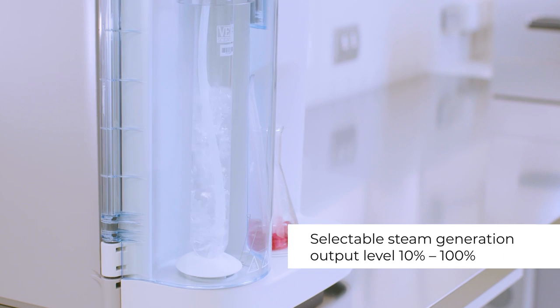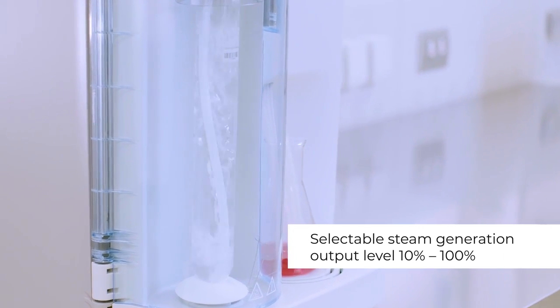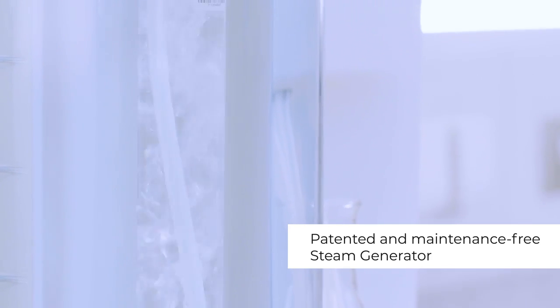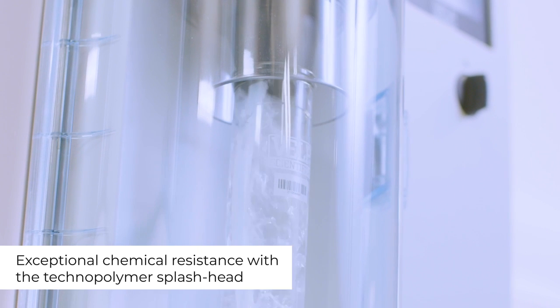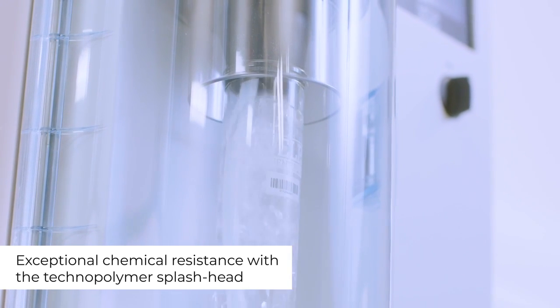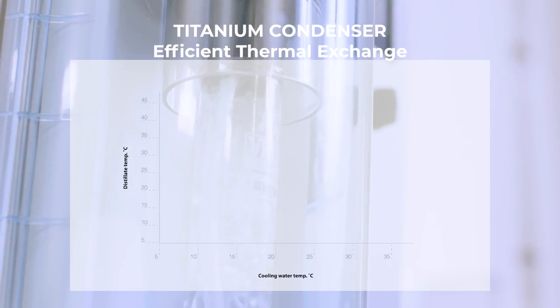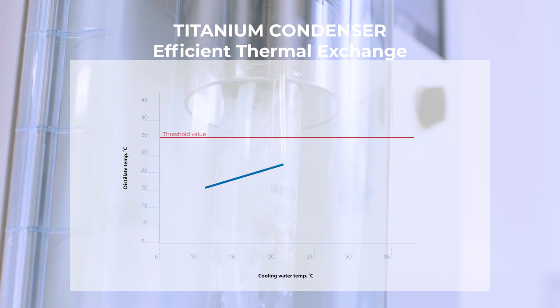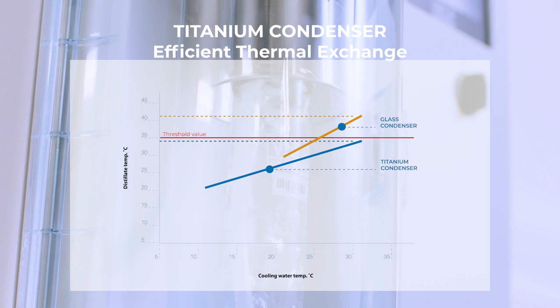The powerful steam flow with variable steam output ensures maximum versatility for any application requirement, powered by the patented steam generator. The unique technopolymer splash head guarantees exceptional chemical resistance and allows ammonia to proceed for condensation. The patented titanium condenser guarantees efficient thermal exchange and low water consumption for a total nitrogen recovery.